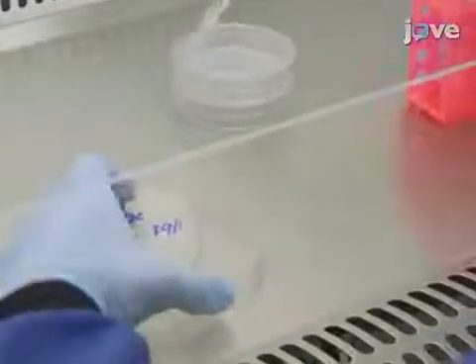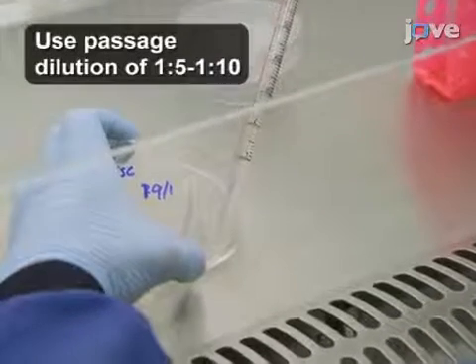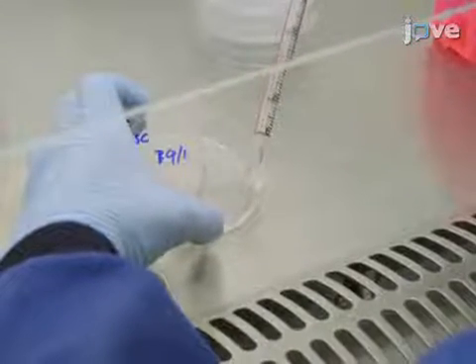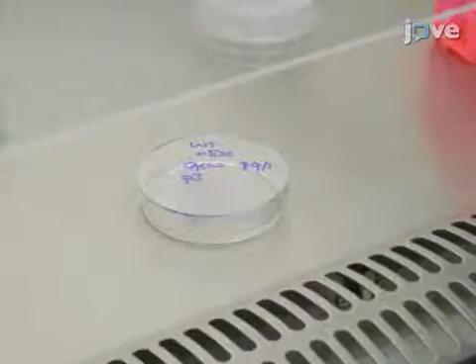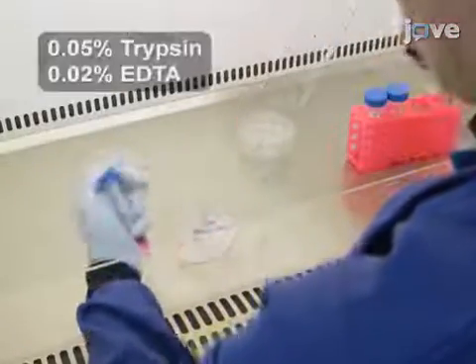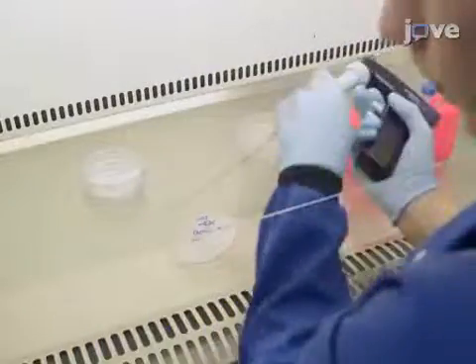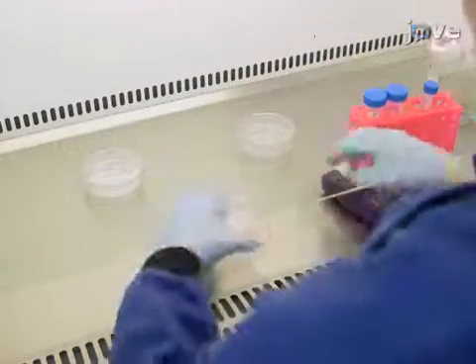Passage the mouse ES cells at around 80% confluency every second day by aspirating the media and washing with 5 milliliters of phosphate-buffered saline per plate. Then, add 1 milliliter of trypsin EDTA per plate of mouse ES cells and incubate at 37 degrees Celsius for 10 minutes.